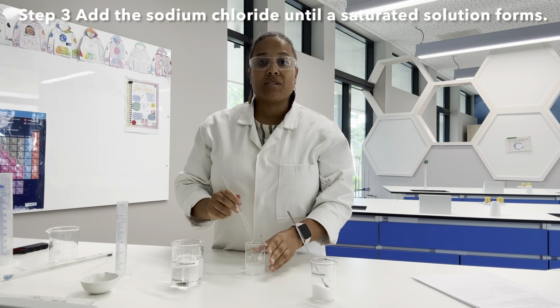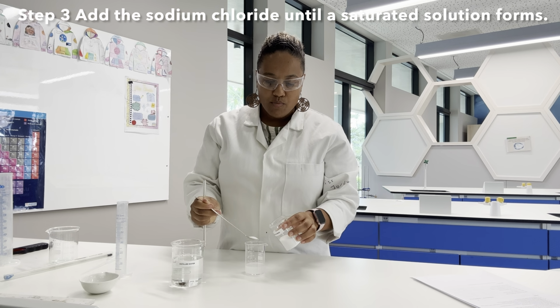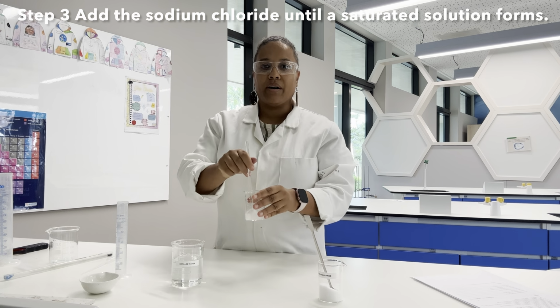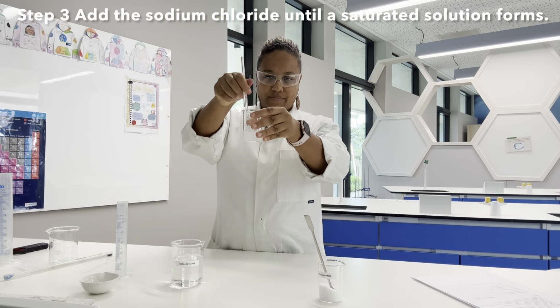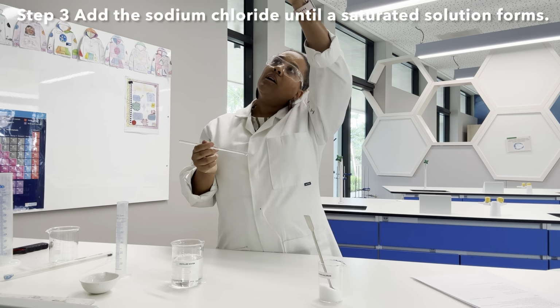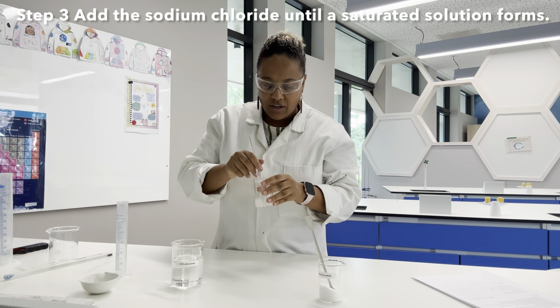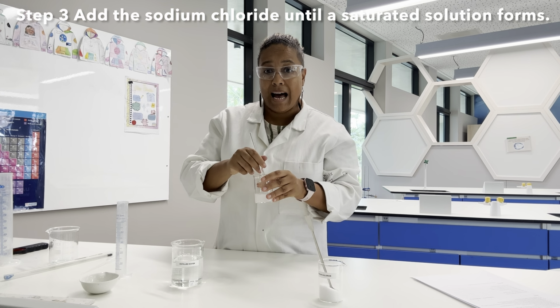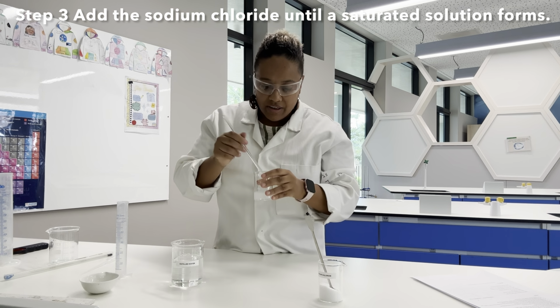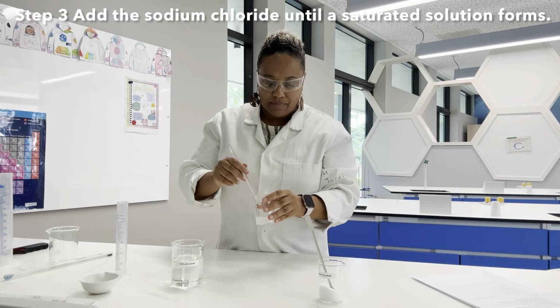So, do you remember what a saturated solution is? That is when no more of our solute will dissolve in our solvent. So I am trying to see, and I might need to at this point, look underneath to see if there's solid at the bottom. So I'm giving a good old stir to make sure that I'm absolutely certain that no more will dissolve. And I think I've got it there. I think I've got some solid at the bottom.